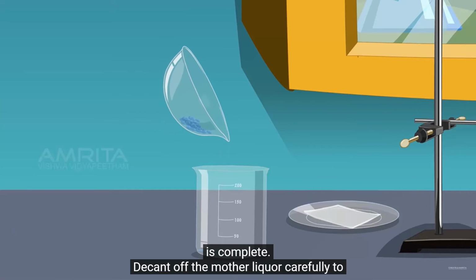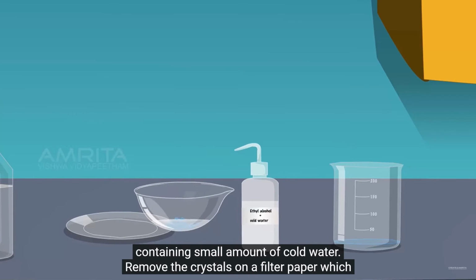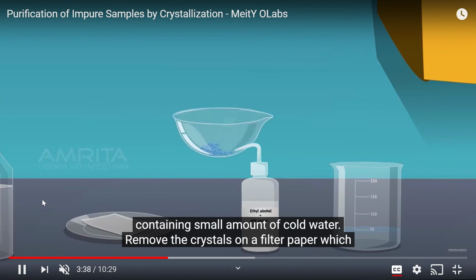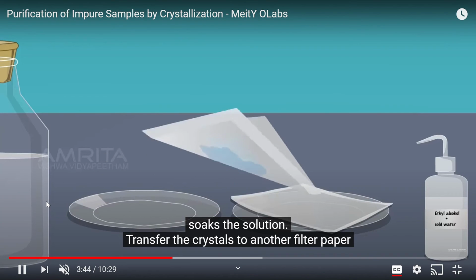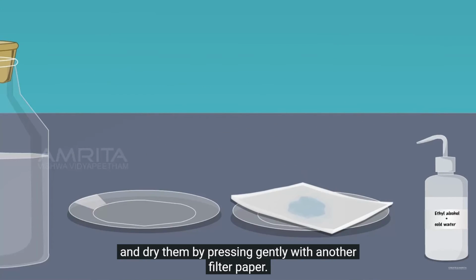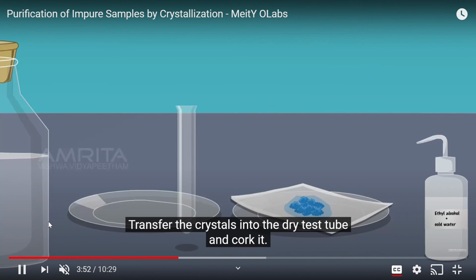Decant off the mother liquor carefully from the beaker and wash the crystals with a little ethyl alcohol containing a small amount of cold water. Remove the crystals onto the filter paper, which soaks the solution. Transfer the crystals to another filter paper and dry them by pressing gently with another filter paper.